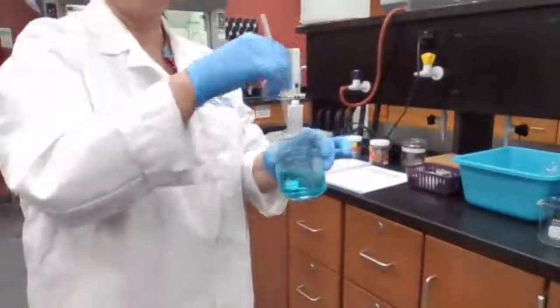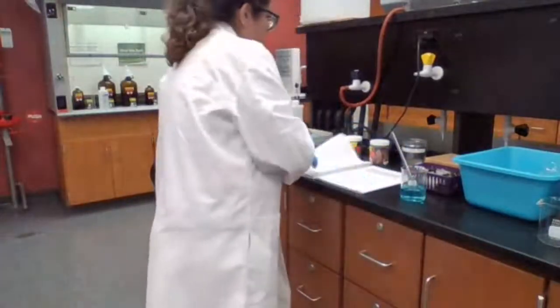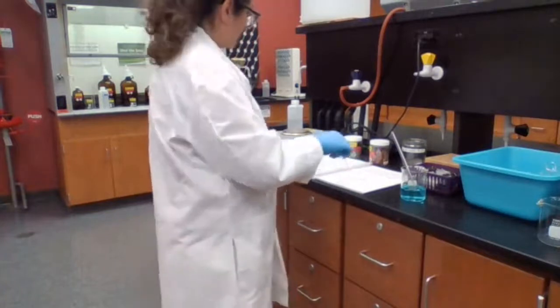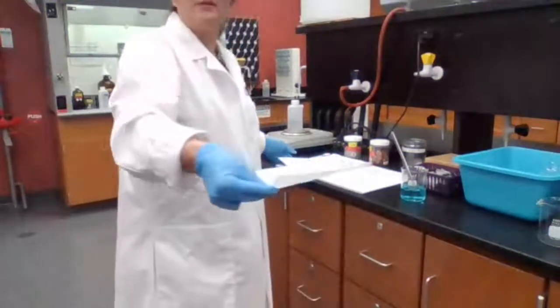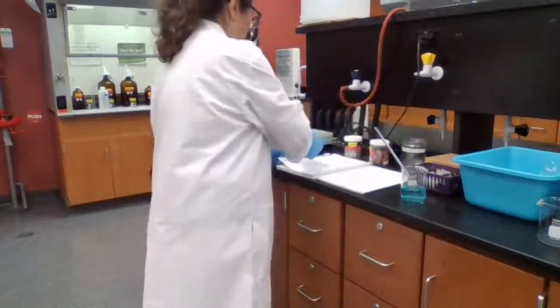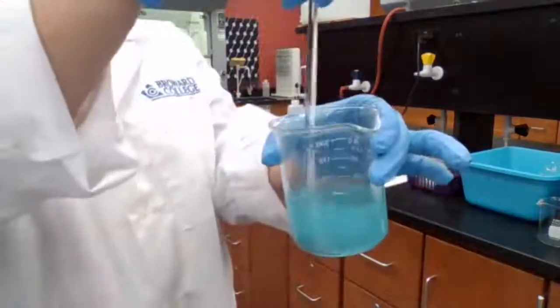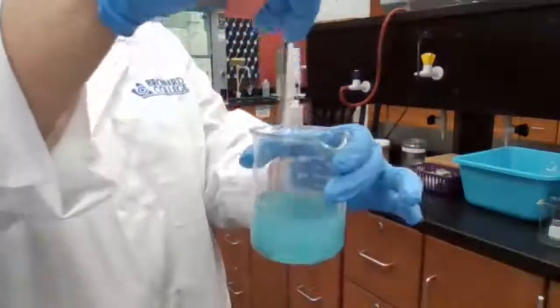With the copper sulfate, we are done with part 4 of the experiment, and we are going to do part 5 now, from copper sulfate to recover the copper. To recover copper, we add the 2 grams of the zinc that I measured already into the copper sulfate solution and let it react. I have to show you the reaction that is taking place. Then I place it in the fume hood just in case there is hydrogen gas coming out too much, I don't want to inhale it.